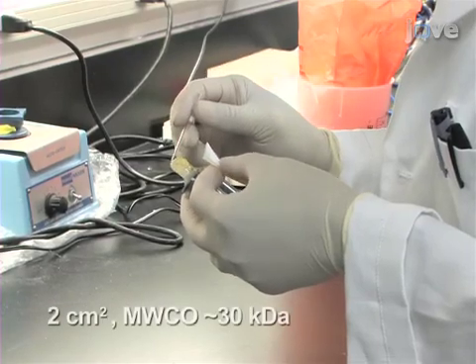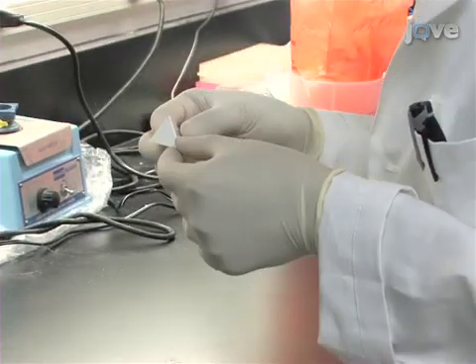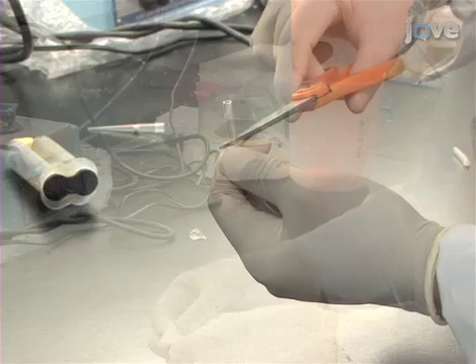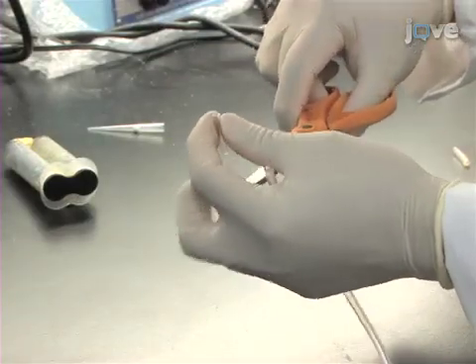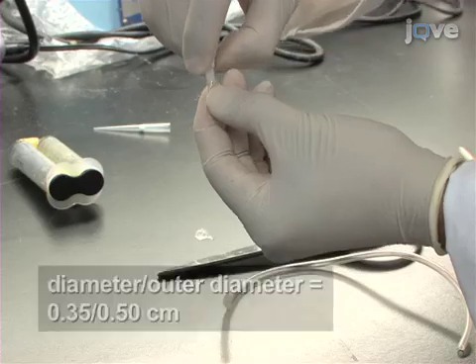Using epoxy glue, seal the polyether sulfone membranes onto the borders of the triangle polypropylene paddles. Then attach a Teflon fluorinated ethylene propylene tube to a cylinder exit of a triangle polypropylene paddle.